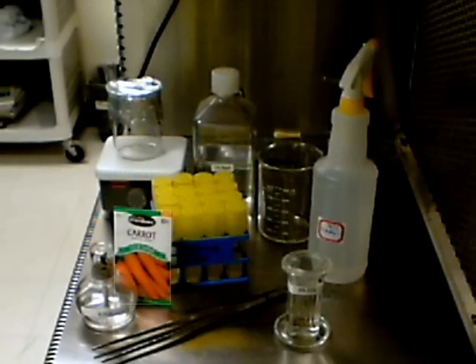In this demonstration we will be germinating carrot seeds in sterile medium using aseptic techniques. The germination medium was prepared using a similar technique to the one used in a previous video and is suitable for germinating a variety of seeds.